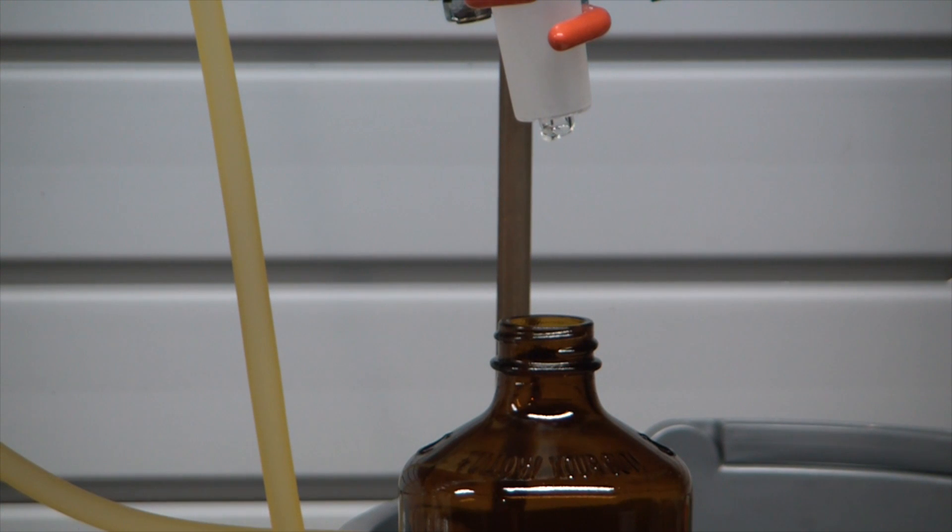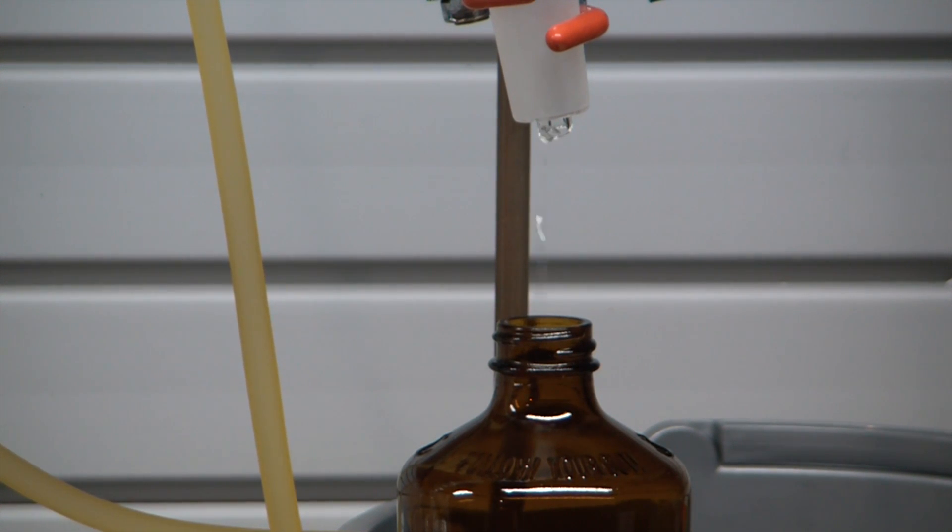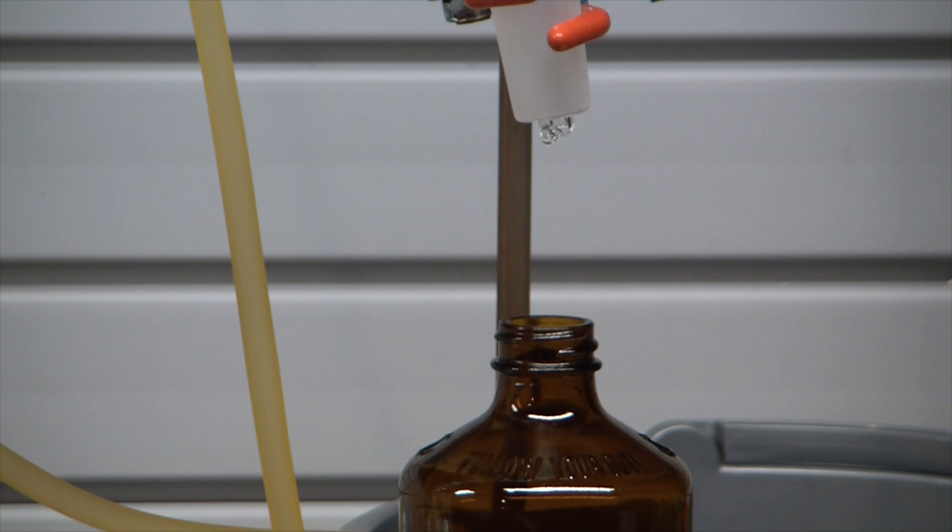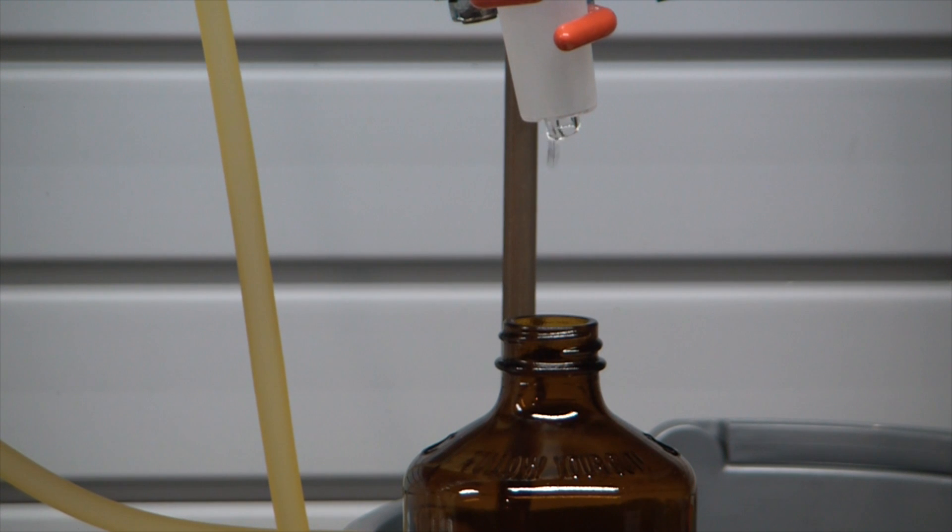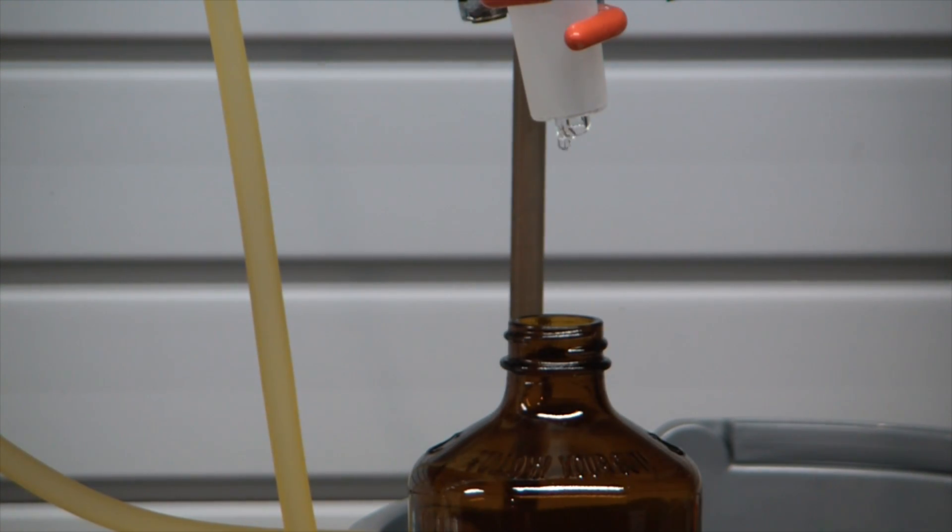So here we are sometime later, got the distillation apparatus running, and of course because distilling your own spirits in the United States is illegal, even if it's not for consumption purposes, I am just running water through the apparatus here just so you guys can see how that would happen. That's some beautiful water coming over.